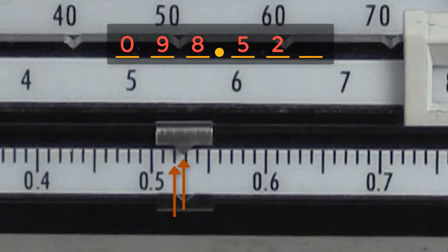If there are ten spaces between one hundredth, then each of those imaginary spaces is one thousandth. Ileana estimates that the pointer is pointing at the ninth of the ten imaginary spaces, so the nine can be added to the final measurement in the thousandth place.